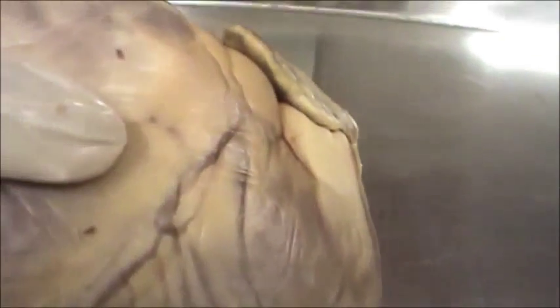Now we have to identify the anterior and posterior side of the heart. For that, you need to locate the ear-like flaps. These ear-like flaps open to the anterior side of the heart, so this is the anterior side of the heart and this is the posterior side of the heart.